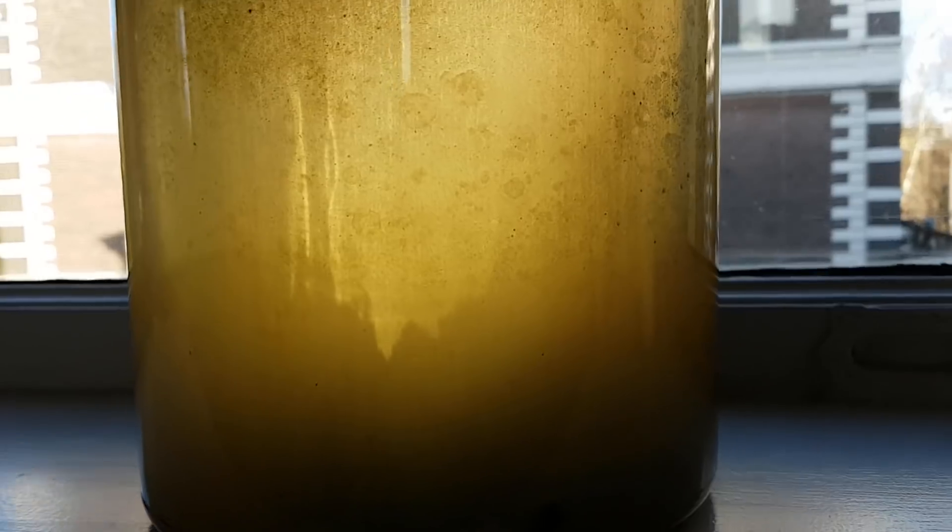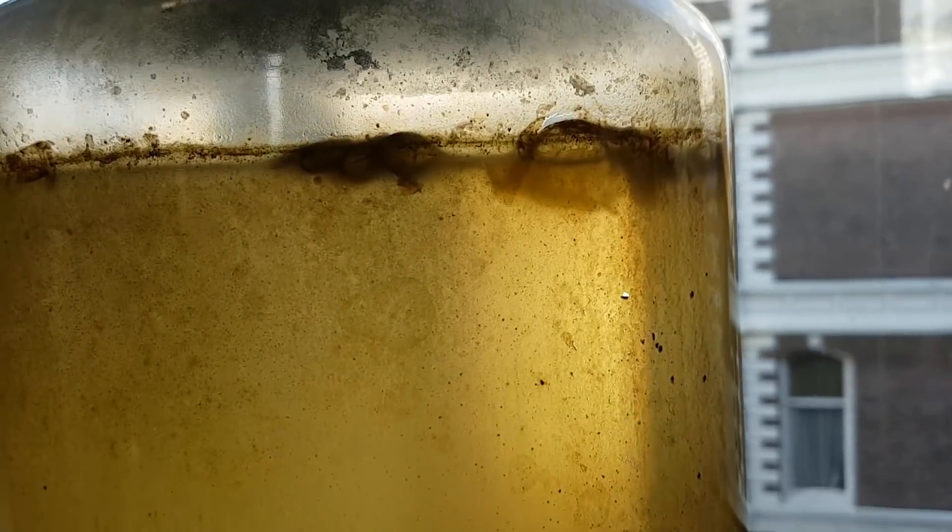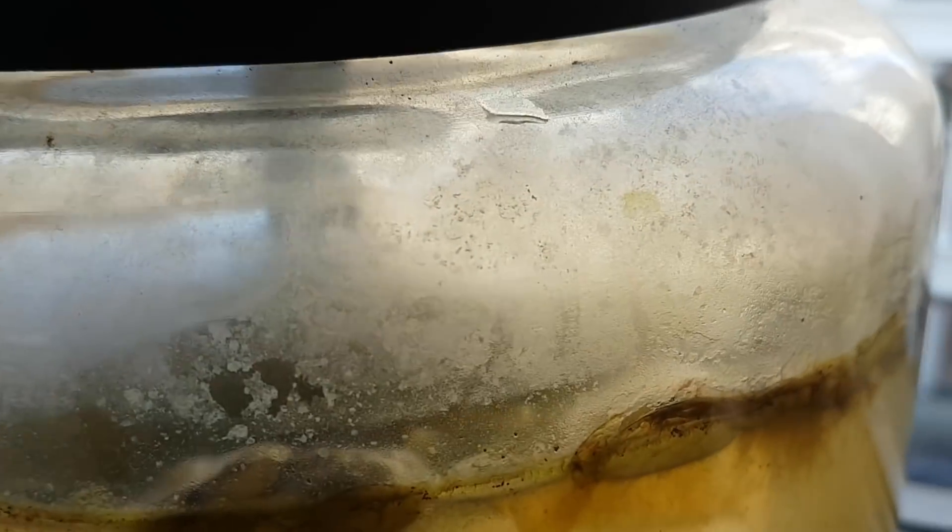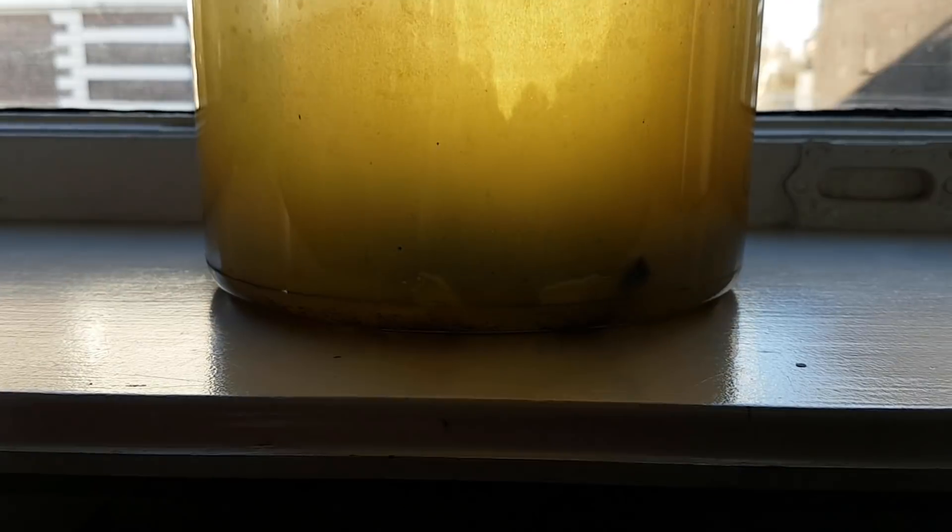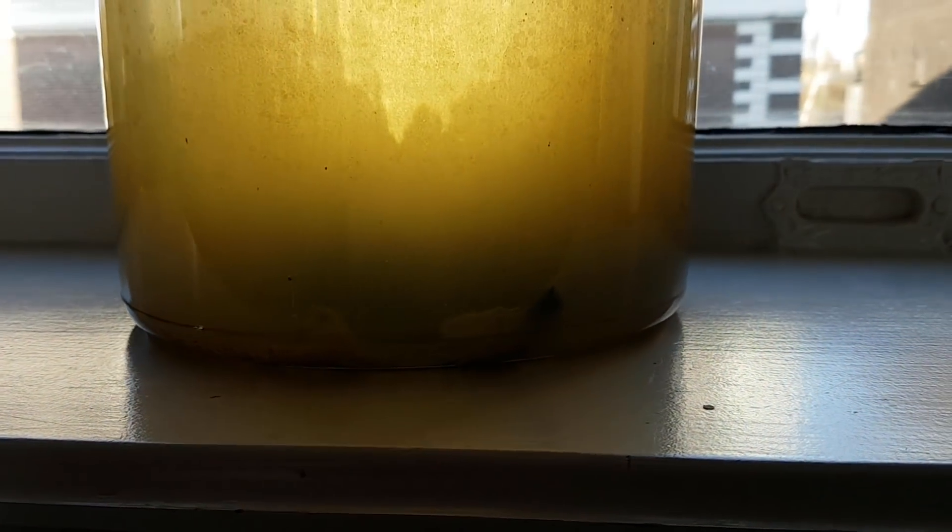About a year ago, I made a brine shrimp ecosphere. This video will be an update, but more importantly, the end of the ecosphere, as we'll open it up, smell it, and look at its contents under the microscope.